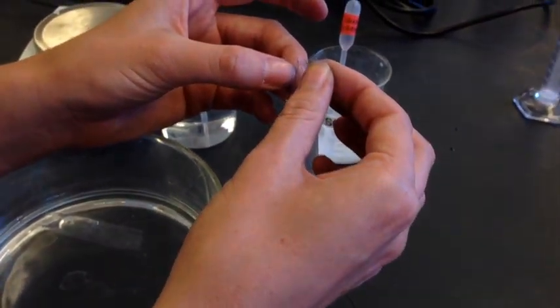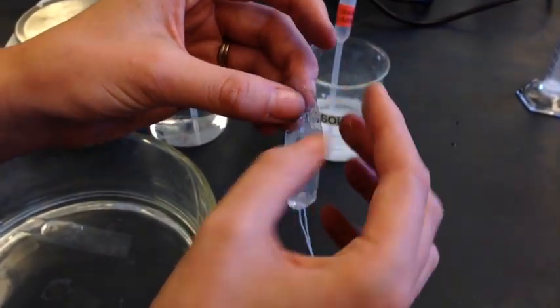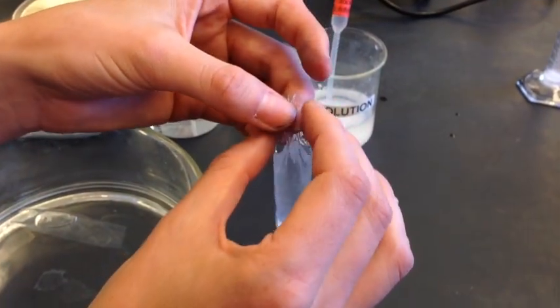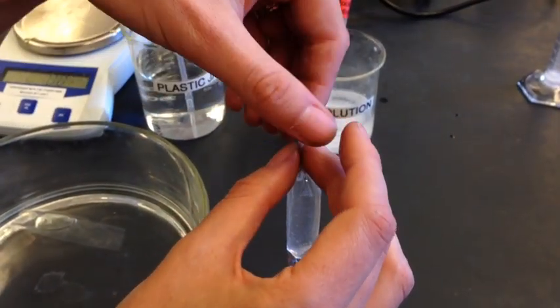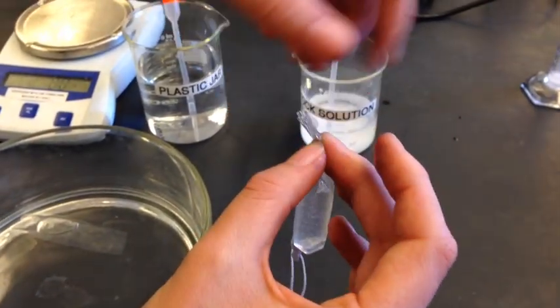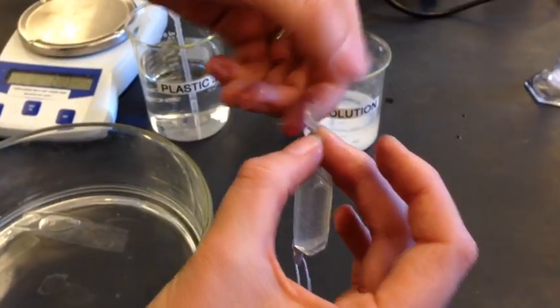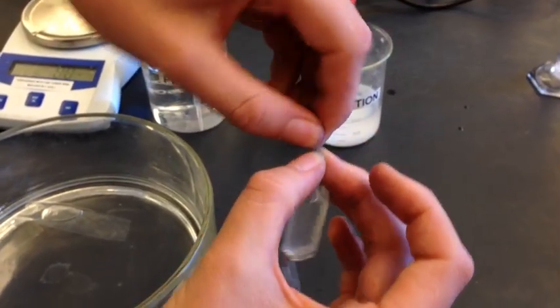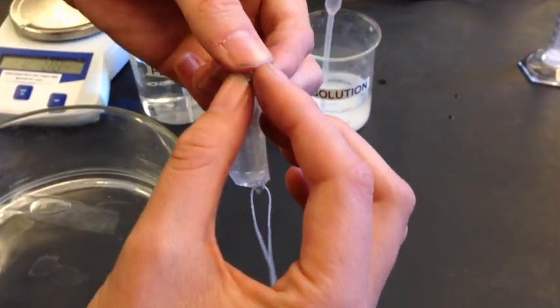Now that your bag is filled with those 10 milliliters, close the other end in the exact same way. Carefully twist and fold over without spilling the stock solution.